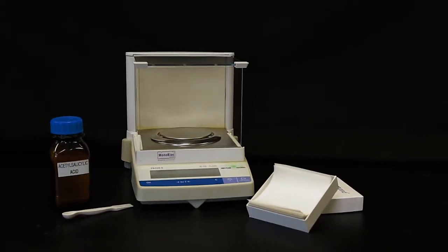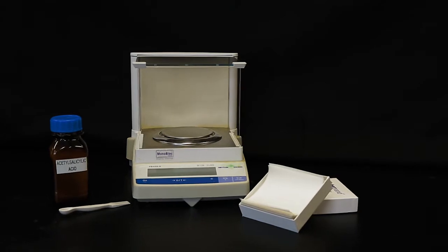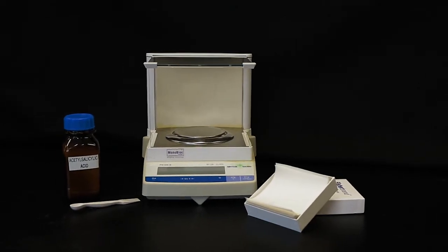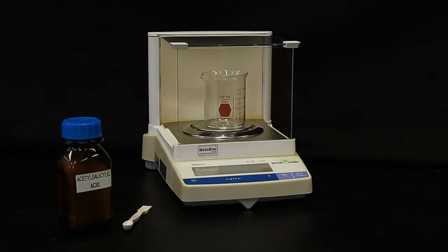Analytical balances in the organic lab allow us to get an accurate weight in grams of a chemical substance. In this video, we will be weighing acetylsalicylic acid.